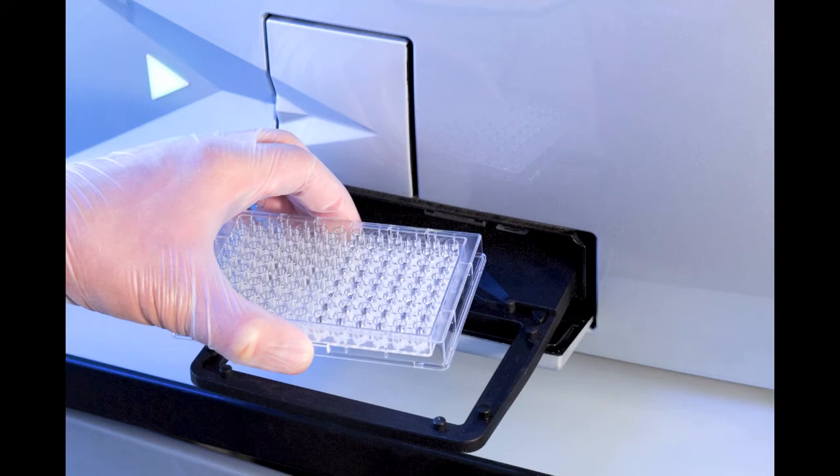The samples may be analyzed by UV plate reader as demonstrated, or by HPLC.